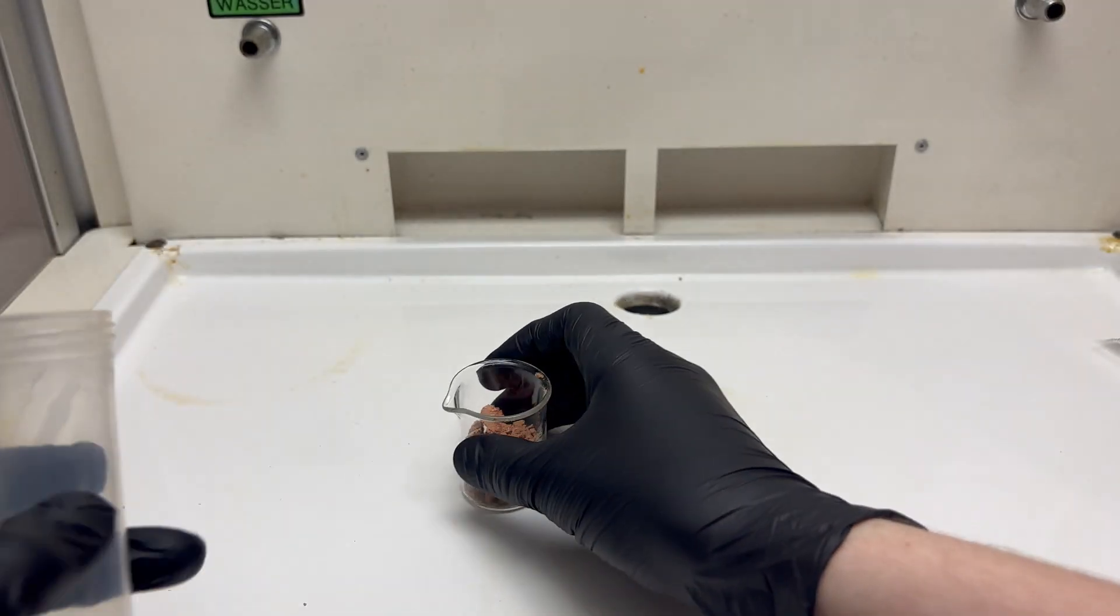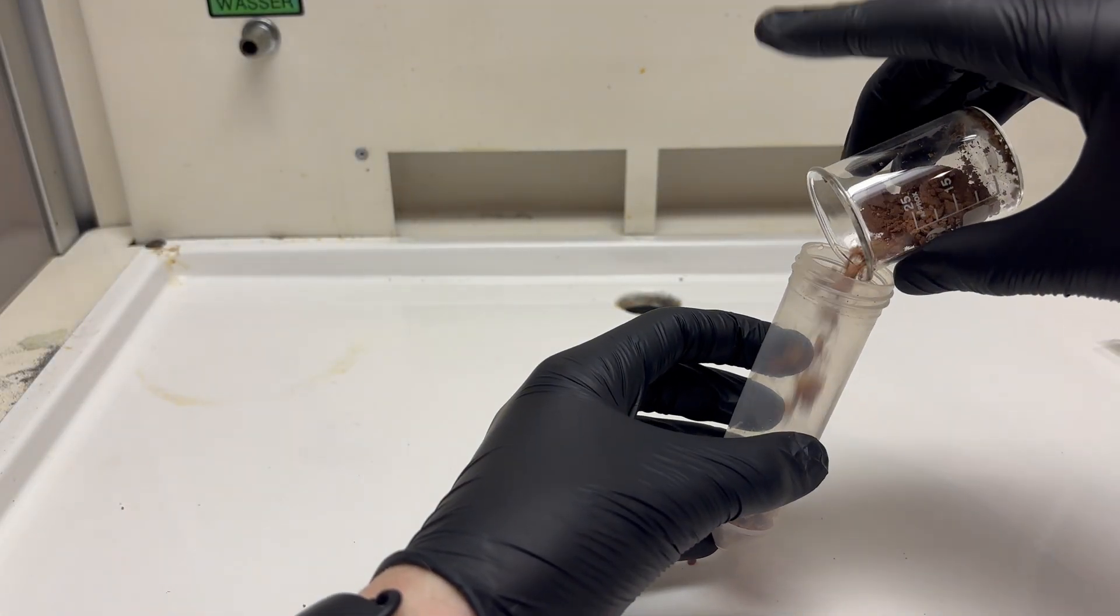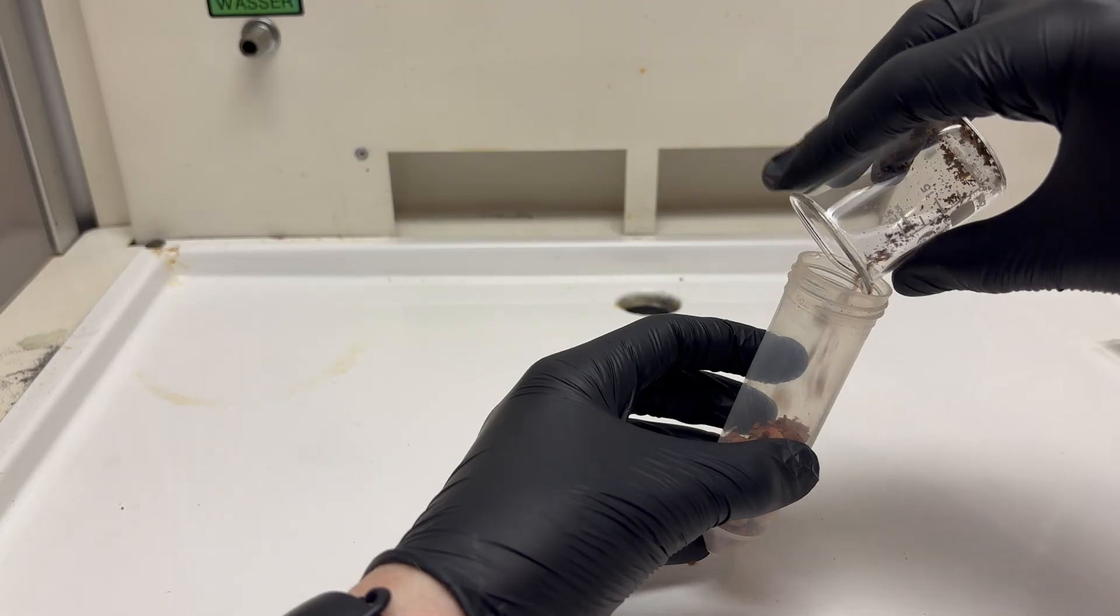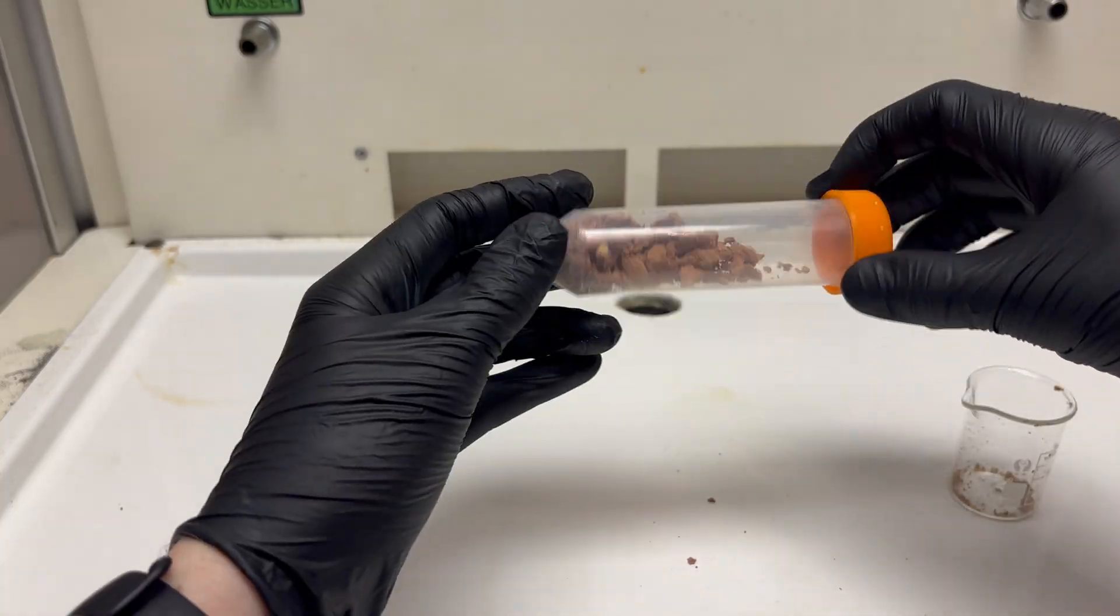The phenylhydrazine hydrochloride was dried in a vacuum chamber and I got a final yield of 10 grams. The theoretical yield was 7.4 grams, but this is probably because there is still some water in it.